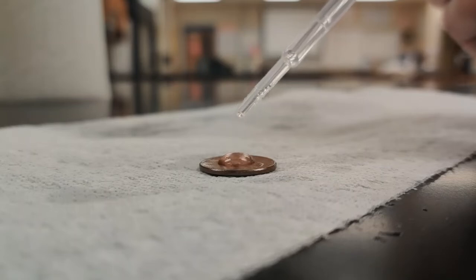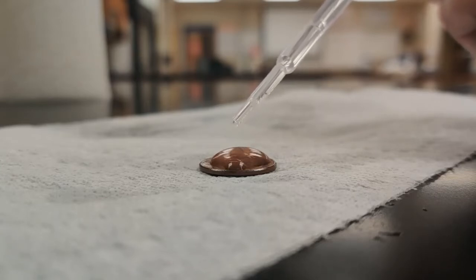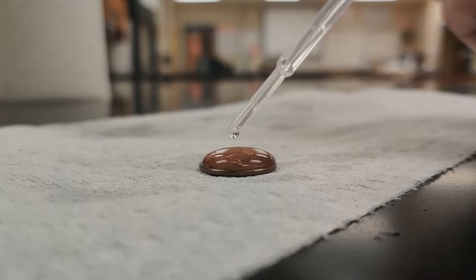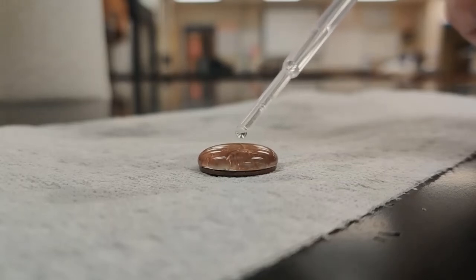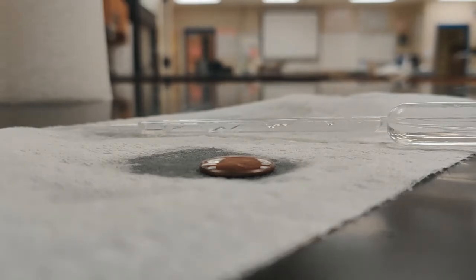1, 2, 3, counting up slowly through 37. So trial 4 is 37.